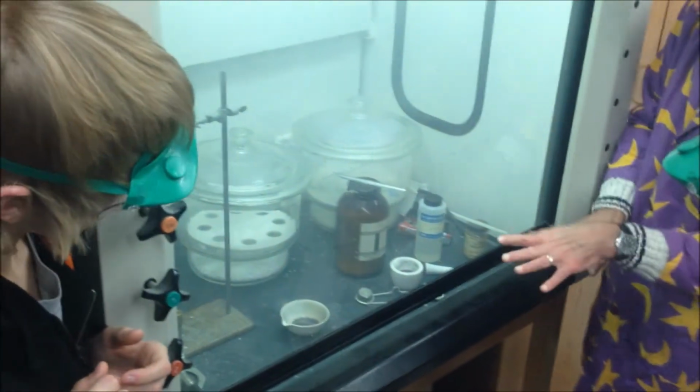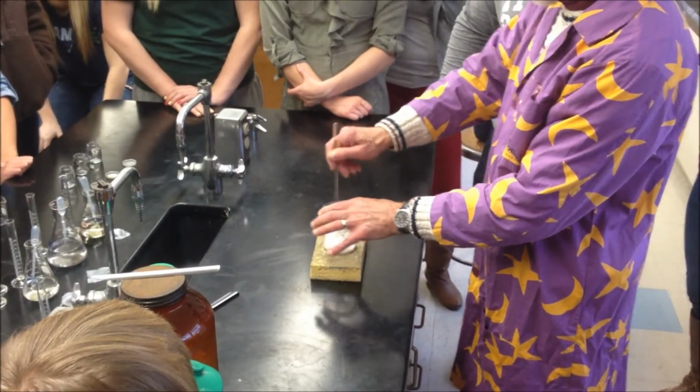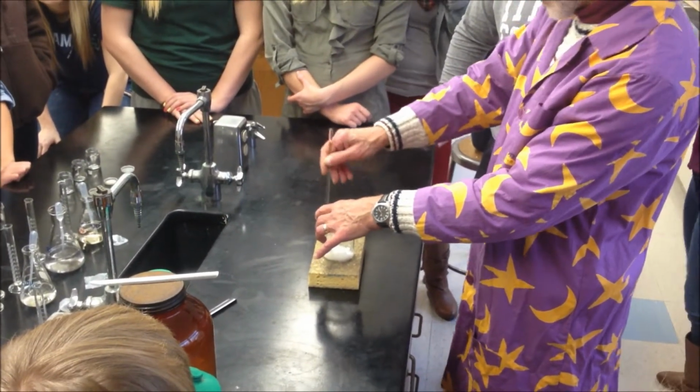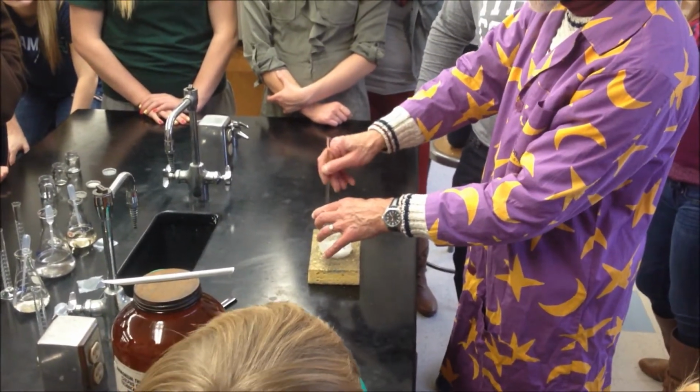Okay, so we'll be back here for something else later. I'm just going to leave that on. It's going to be very smelly. So watch what happens. What do you think, what did I say the name of that second one was?